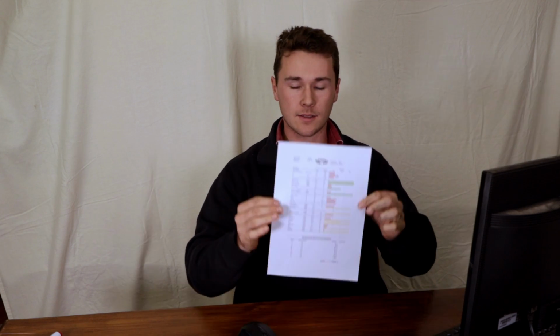G'day, if you've ever wanted a Haney soil test analysis interpretation, this video is for you. Today in this video, I'm going to show you how you can actually get a free interpretation from our website. I'm going to run you through how to use the tool.